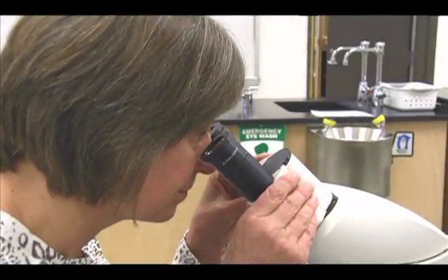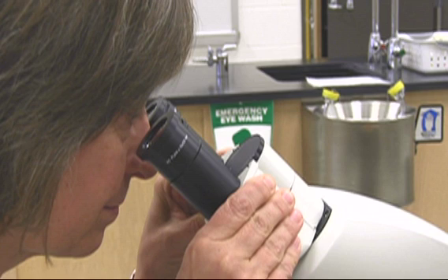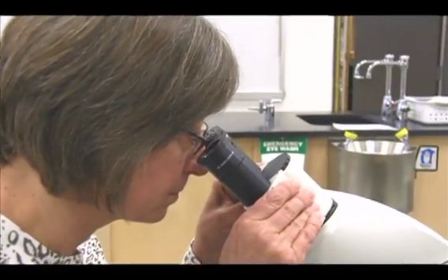Look through the oculars and move the viewing tubes until the image resolves into one circle of light. Do not press your eyes against the oculars. Keep some distance. You may use the microscope with or without glasses.